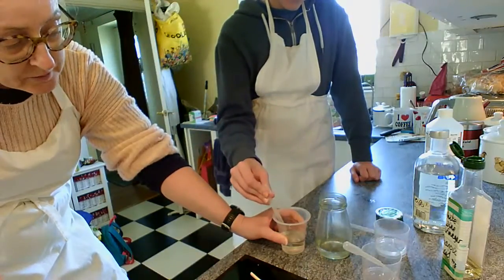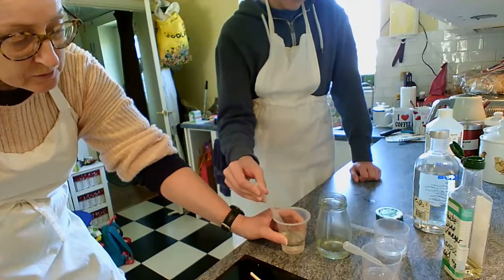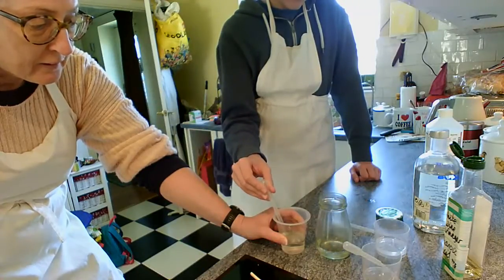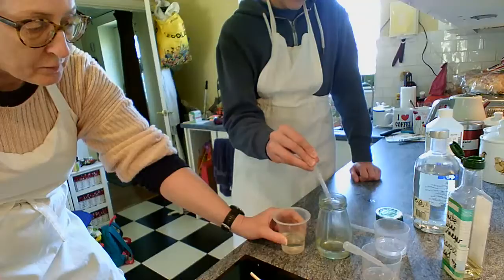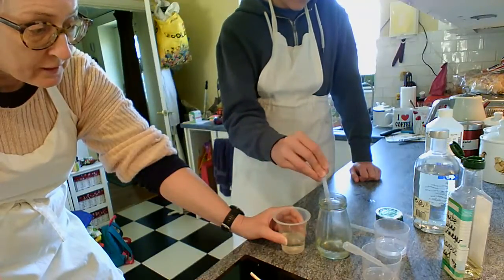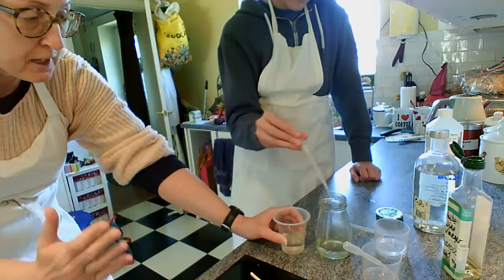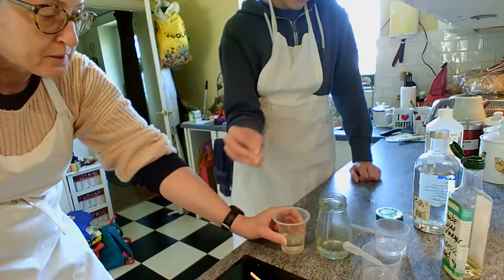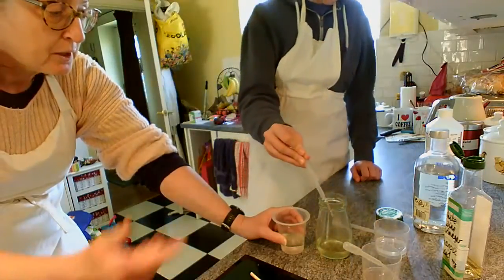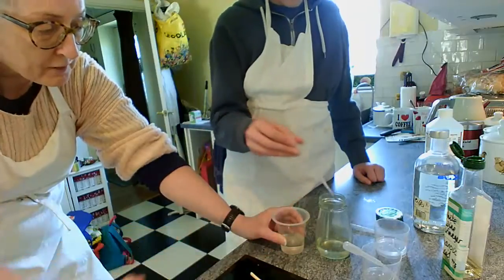It should be okay on skin. It will tend to attack your clothing more than your skin, this will. As long as we're right by the tap, which we are, and we rinse it off very rapidly, it shouldn't be too much. It shouldn't be a problem at all, actually. And of course, you don't get it in your eyes, which is one of the reasons why we use the conical flask, because the conical flask is narrower at the top, so it's more stable, and it also reduces any splashing up, because splashing up should hit the sides of the jar.